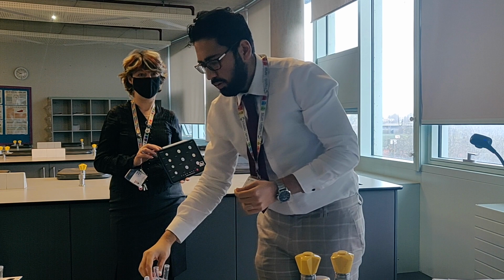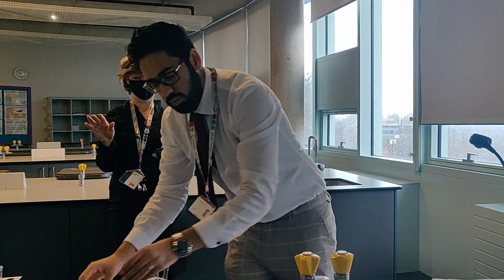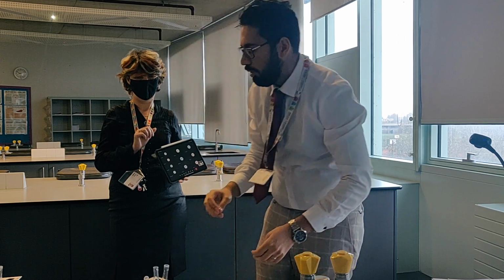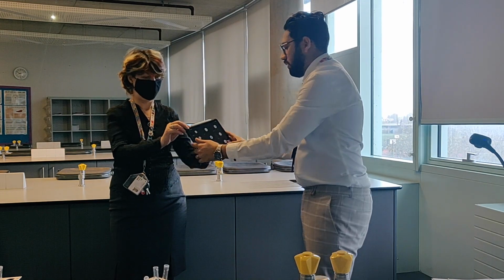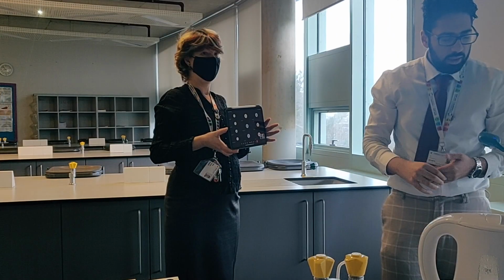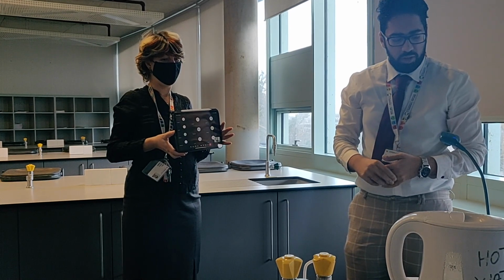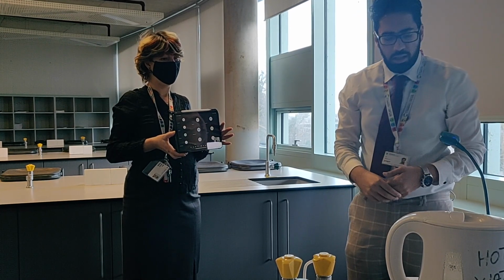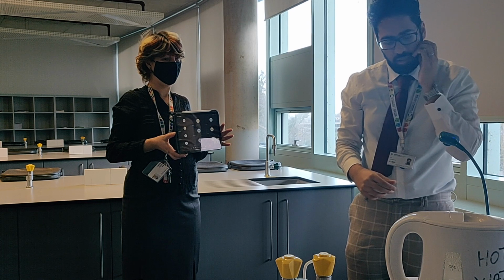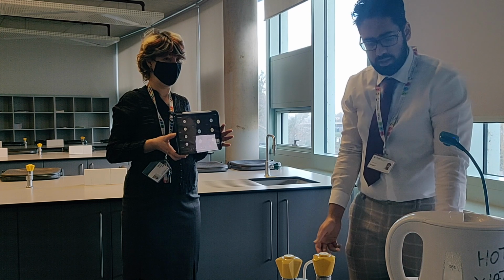Okay, so that's the group 2 tests. We're going to go on to another test in a moment, so just give us a minute to set this up. When we go through it, it should also be in your lab books anyway. Try to remember the steps as much as you can, and try to think about how we can maybe reduce error, although there's not many ways of reducing error in these experiments.